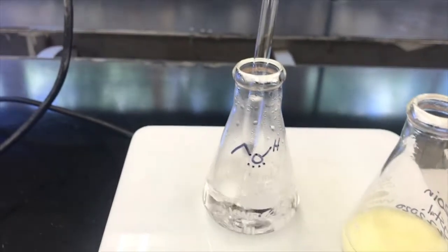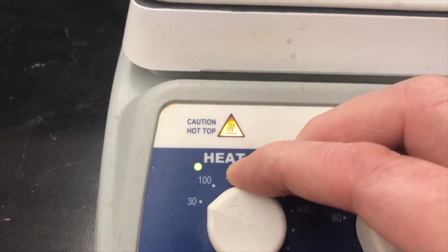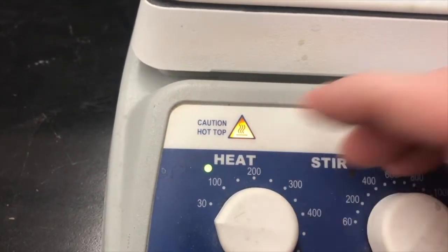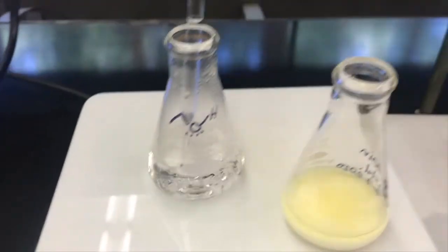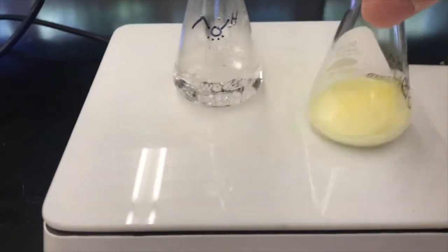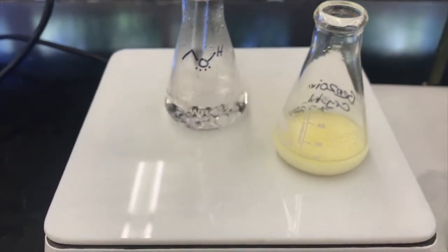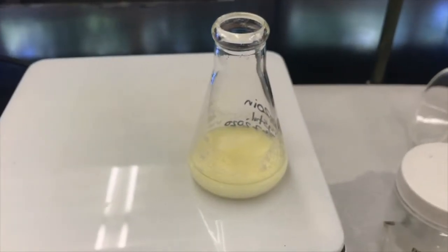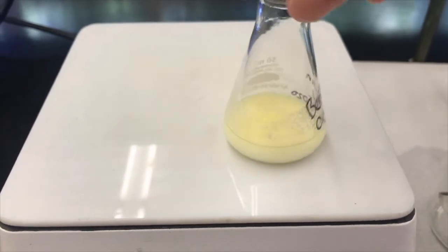It's boiling pretty good off those boiling stones. I'm going to go ahead and turn the temperature down again a little bit until it stops. The light turns off. I don't know why. Put it at 100, I'm not sure. Okay, so let's see. Swirl this around, see what happens. Put this over here for a moment so I don't evaporate it all the way too quickly while this is warming up.